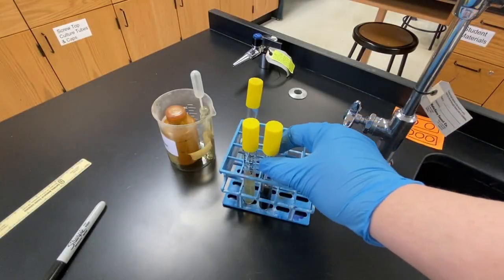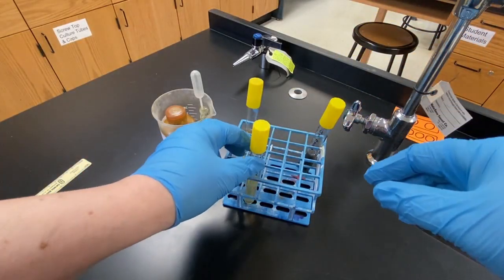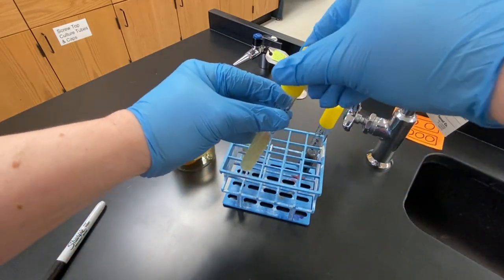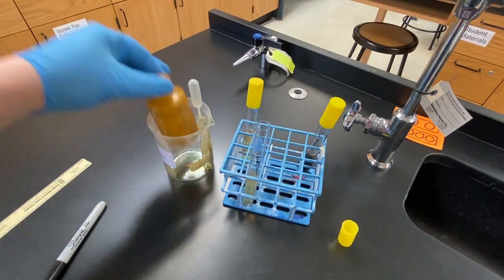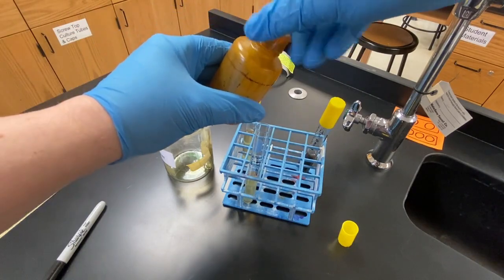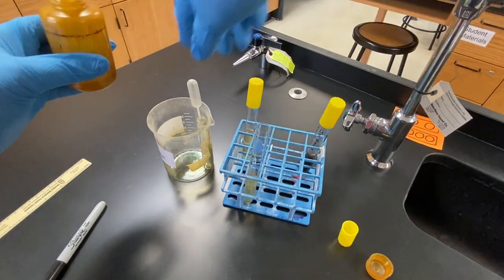The SIM tubes are subcultures, so we do not need to worry too much about contaminating the tubes. However, the Kovach's reagent is toxic and needs to be handled with care. Taking precautions not to spill the reagent, use the pipette to add the Kovach's reagent to the top of each tube, up to the mark.